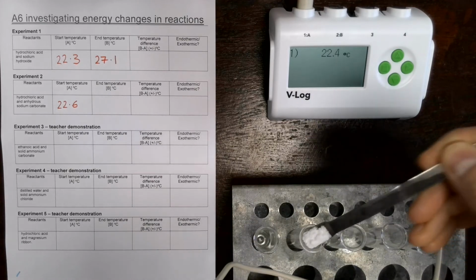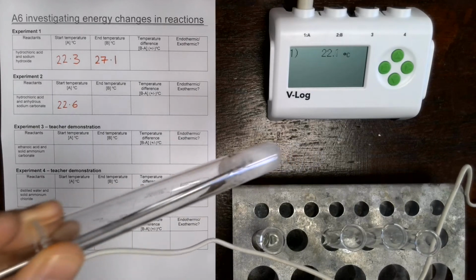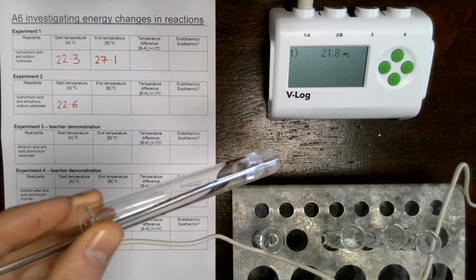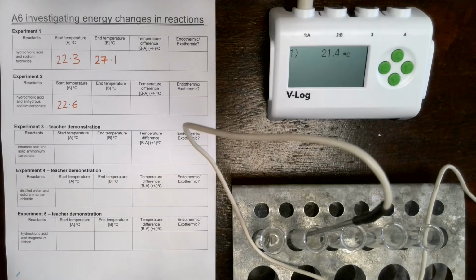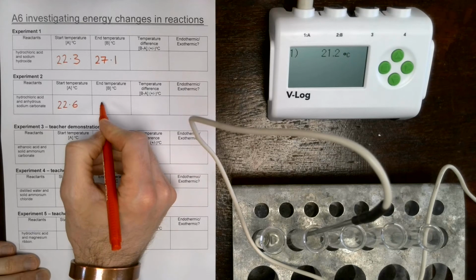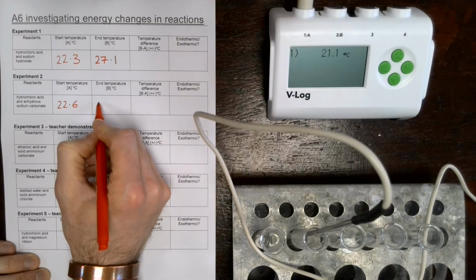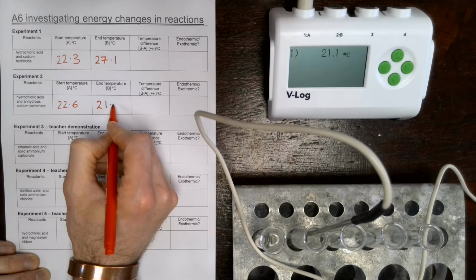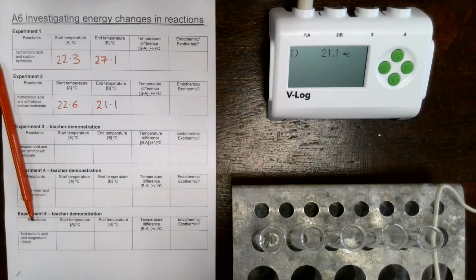So I'll try and show you that reaction as it's happening. Let's place our spatula in. And we've got some fizzing. Hopefully you can see that happening now. You can see all of the bubbles just appearing. Quite a quick reaction. Let's measure our temperature change. So the end temperature for this one will stop in a few seconds. 21.1 it is. Okay, let's clean that up and we'll go for reaction number 3.